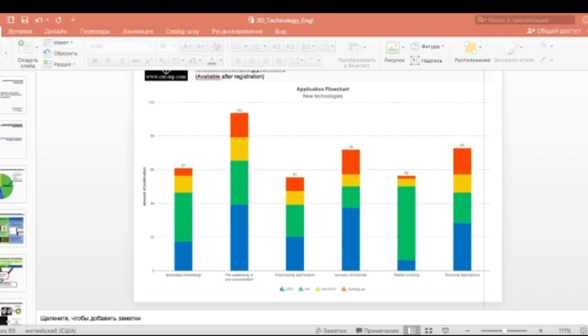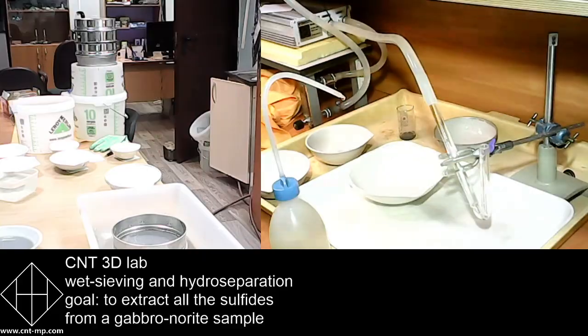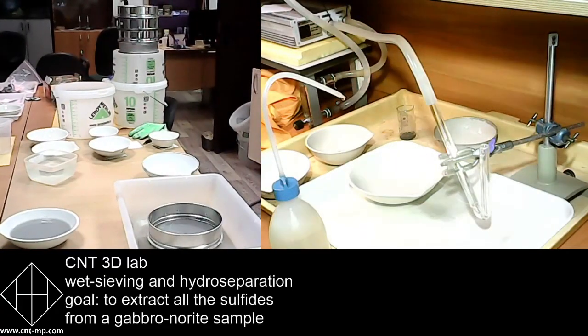theory on the stage 3 of our training and internship, and we switch to Oleg, to his lab. I want him to show you guys how to make wet-sieving, and I will comment basically how that should be done in a proper way, in a proper manner. So I hope you hear me still.